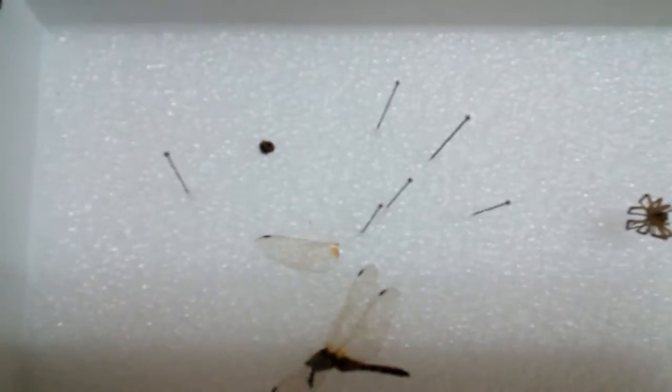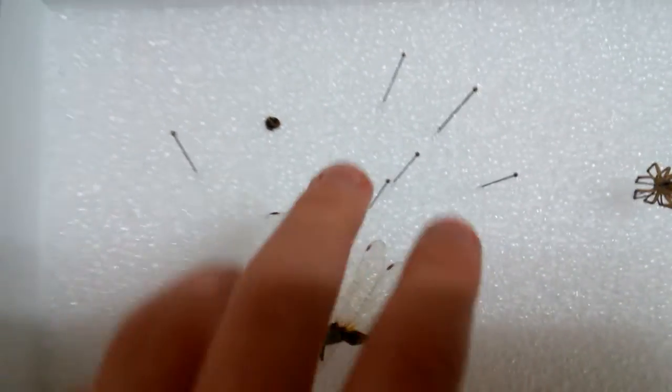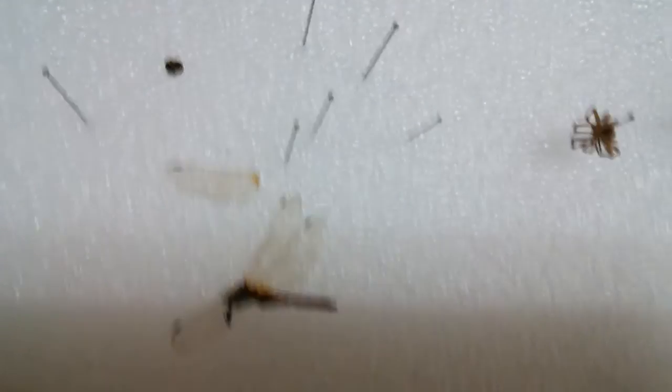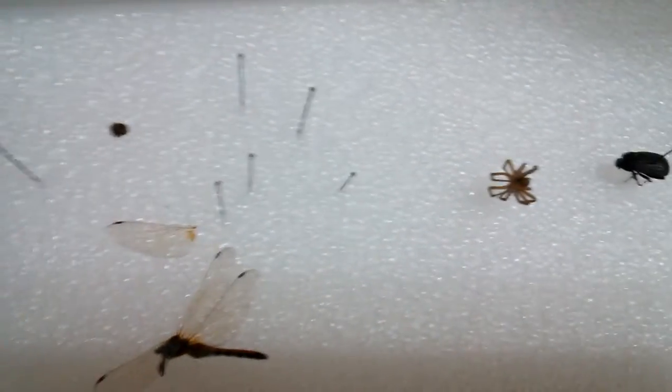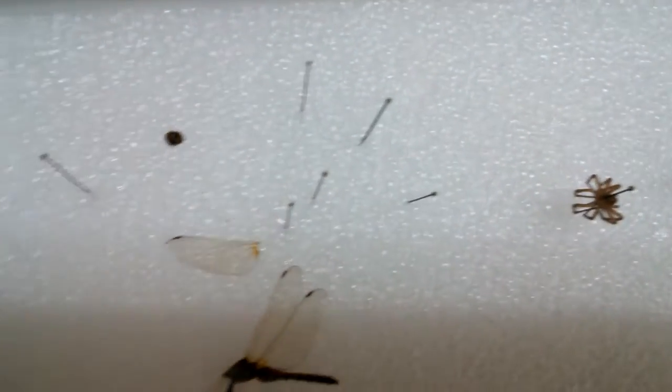Today, I'm going to show you how to pin a dragonfly. A dragonfly needs basically a lot of pins. First of all, you need to pin the thorax.